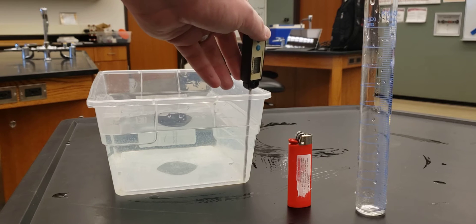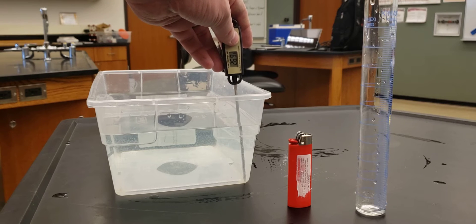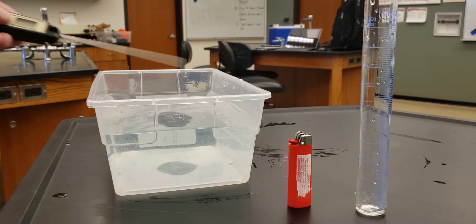So I've got my digital thermometer here, and I would just put it in and read the temperature for my water, which right now is saying roughly 27 degrees. Okay, so it's nice and comfortable.